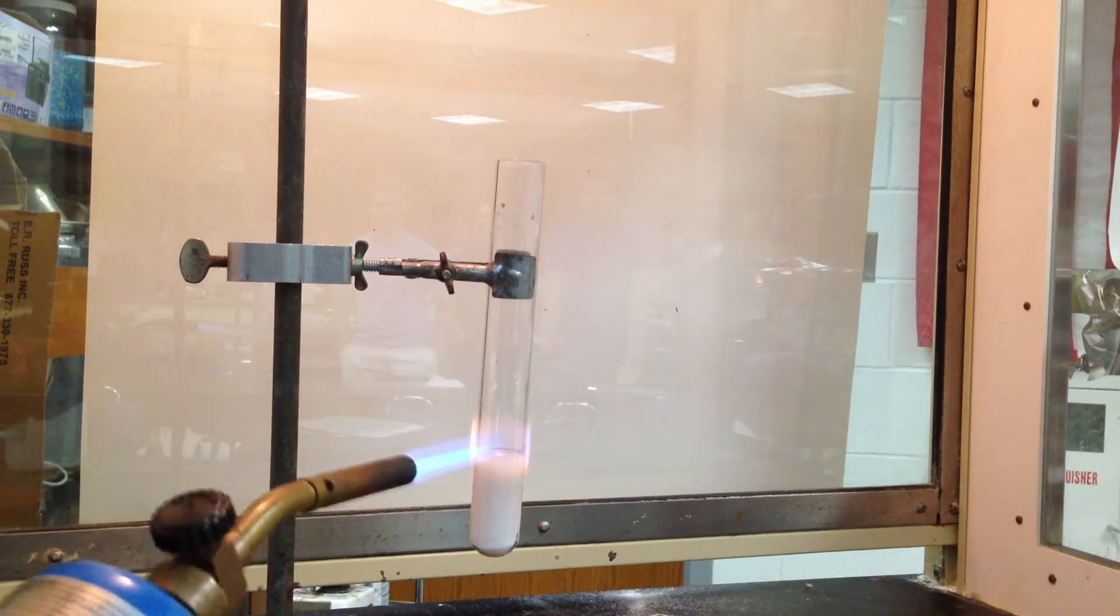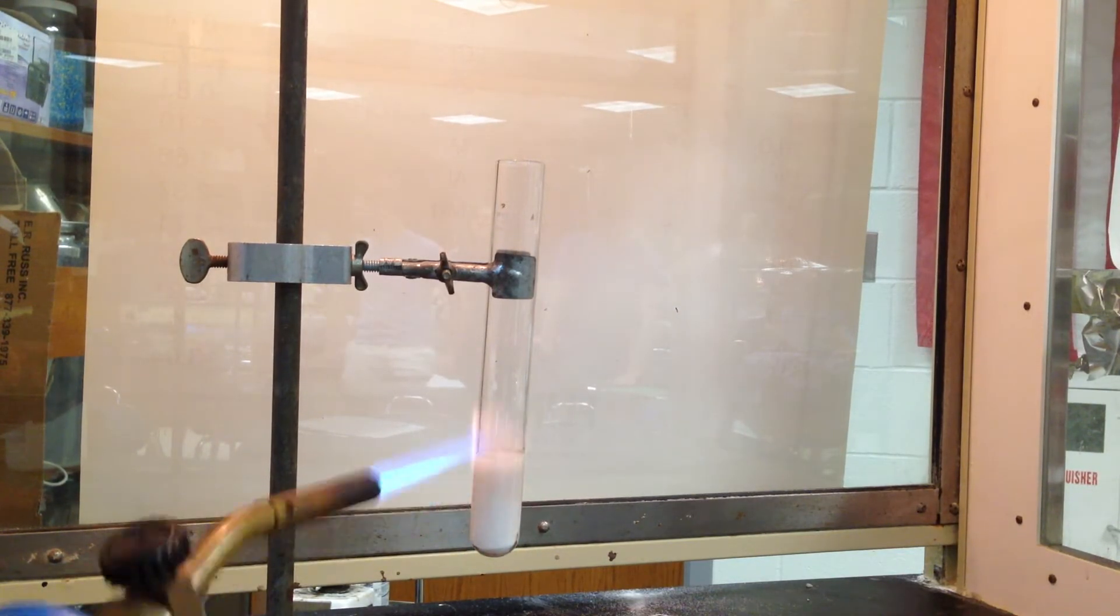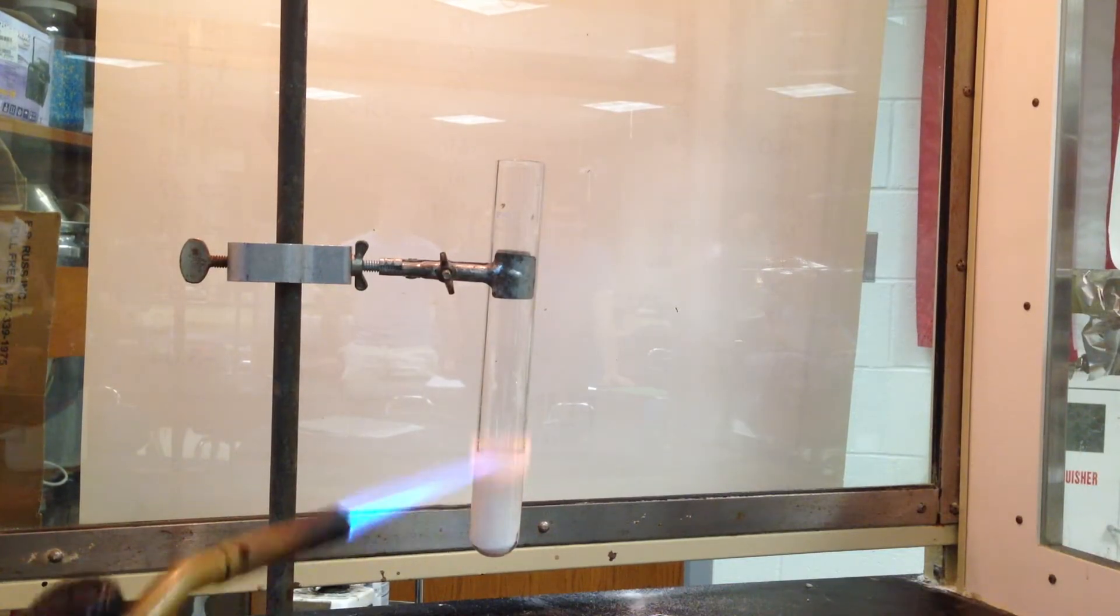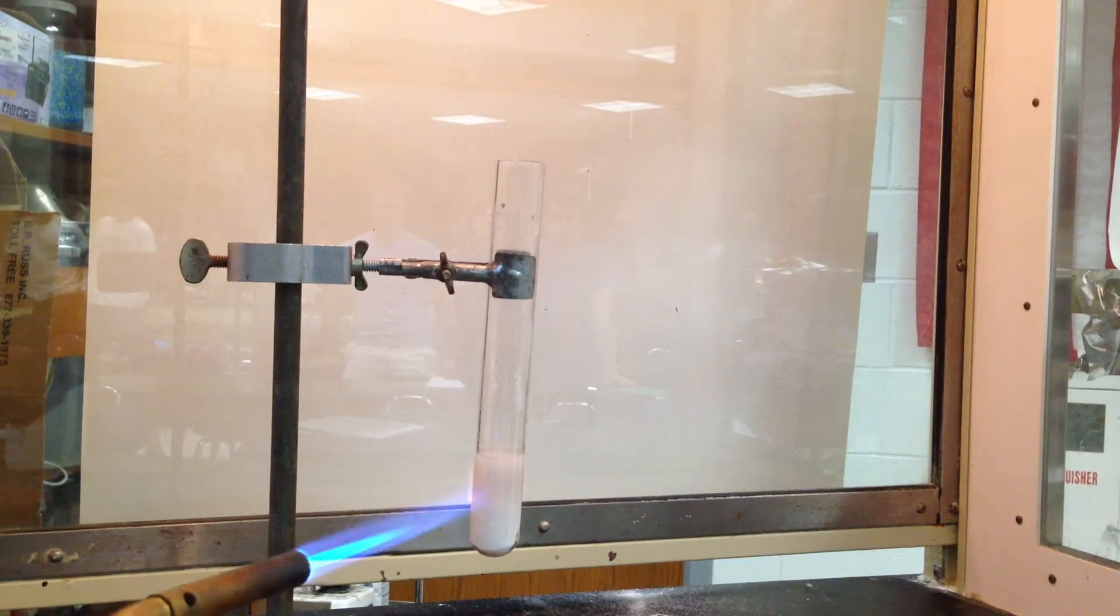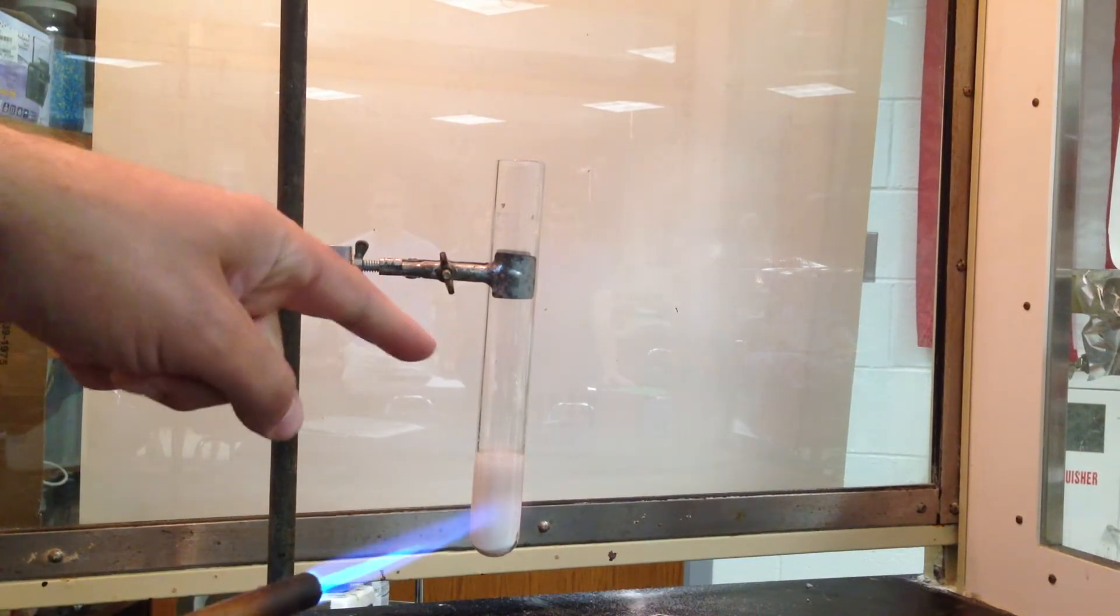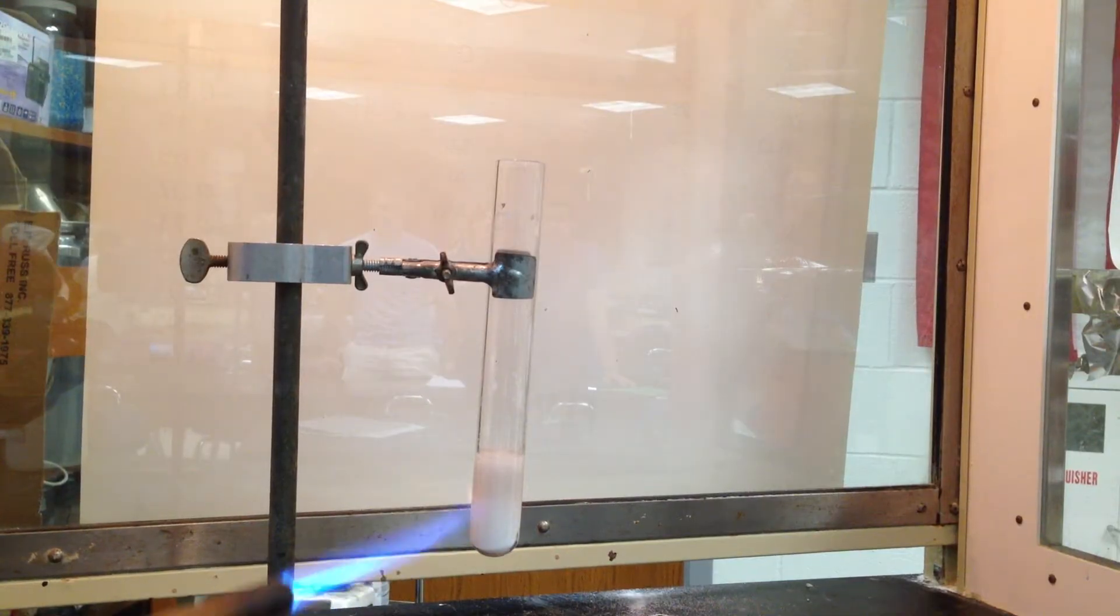So in any case, that didn't quite work. But I now have the potassium chlorate into a liquid phase. See, it's boiling. And in this white smoke, if you can see, is the potassium chloride salt produced. So we're ready to rock and roll.